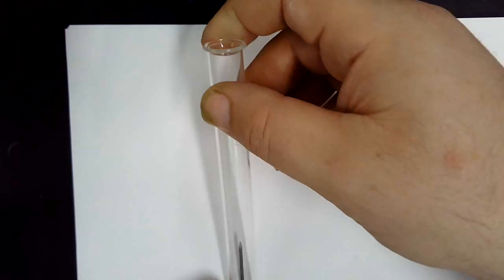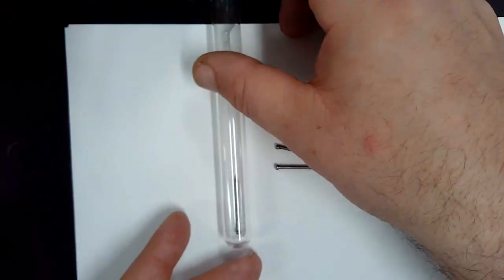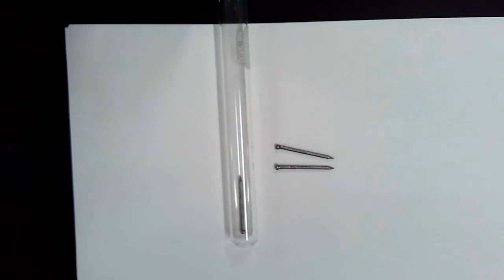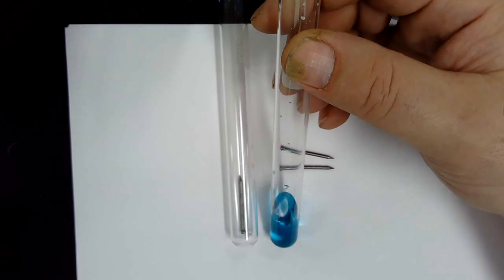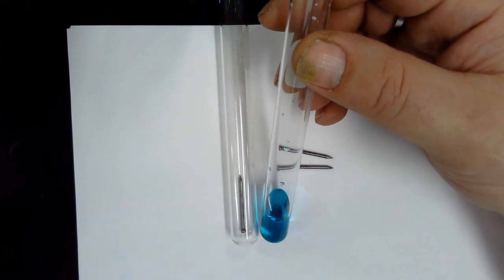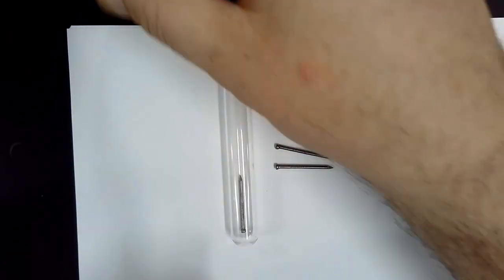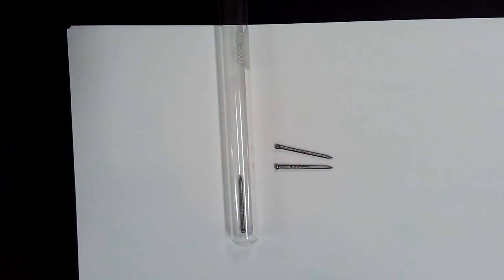Okay, we have 1 iron nail in a test tube as a control, and I do have some copper 2 chloride in a test tube as control. I will leave that one in the test tube rack so that you can check it against. This is our test tube that we're using for the experiment. I will add some copper 2 chloride to the test tube.